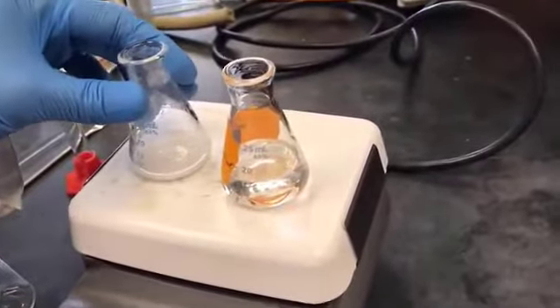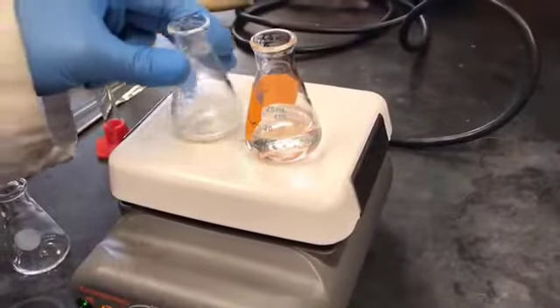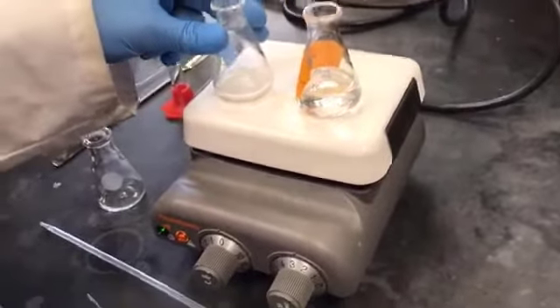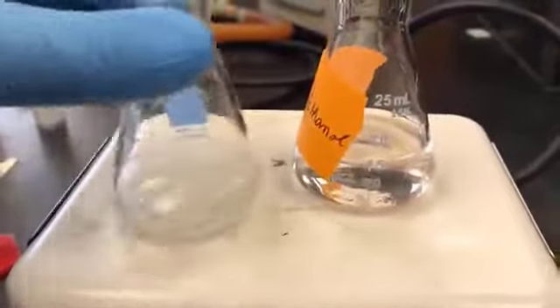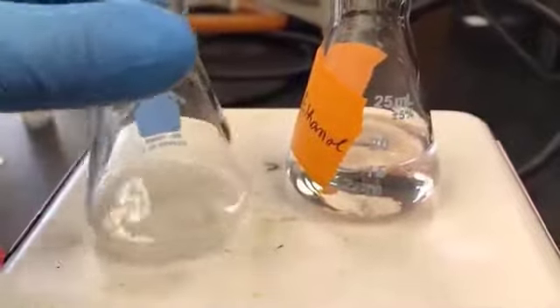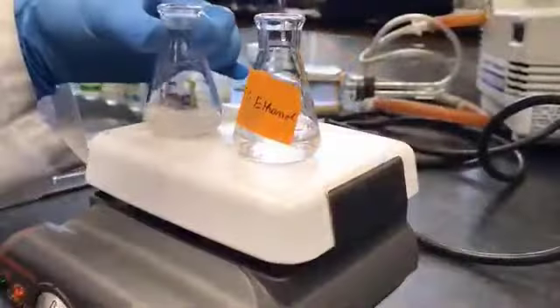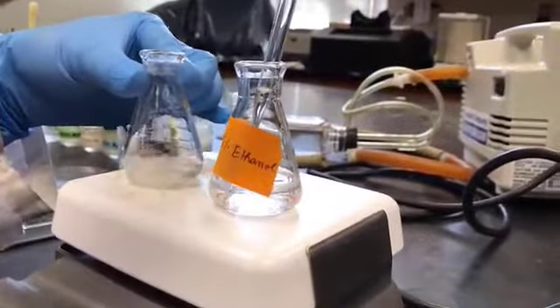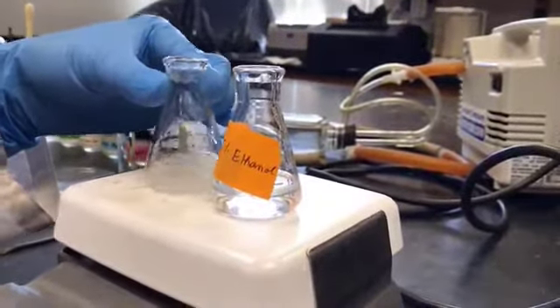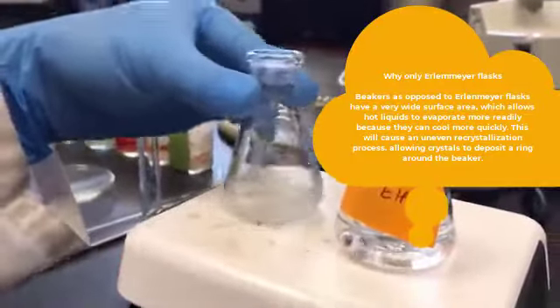It just stopped boiling, so I'll increase the heat so that it will start boiling again. And then I'm going to add 0.5 milliliter at a time in order to dissolve it, so that I will get the minimum amount. So I have added 2 milliliters of the boiling ethanol so far, but it hasn't dissolved completely. So I'm going to continue my process to get the minimum solvent. Now I'm going to add the last 0.5 milliliter to have all 4 milliliters as per the pre-lab calculations. And then I'm going to swirl it and see whether it will be completely dissolved or not.